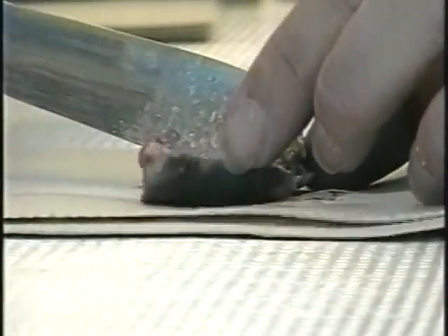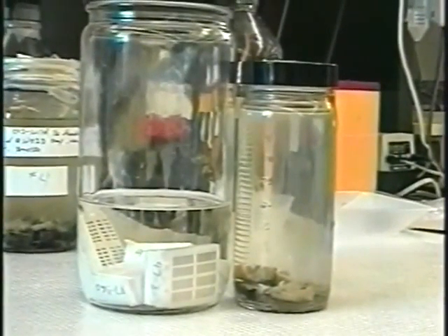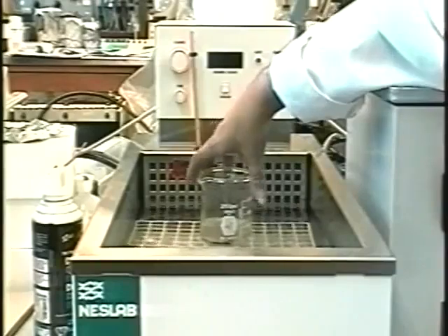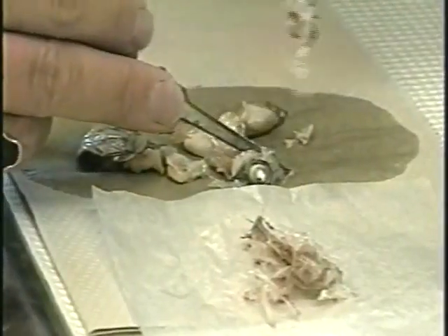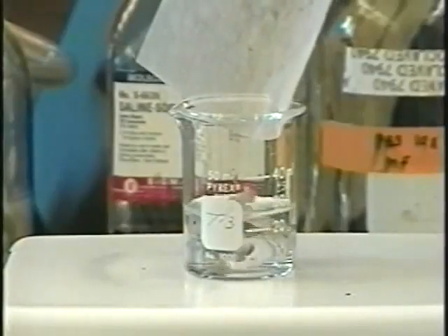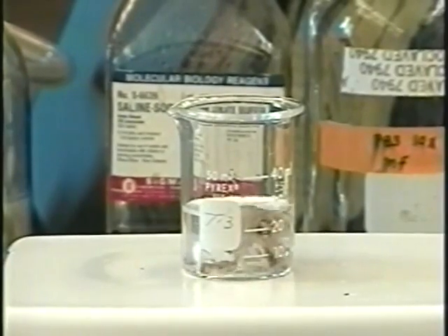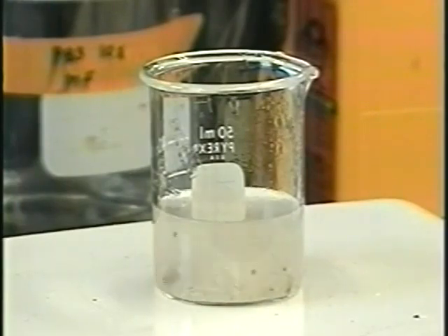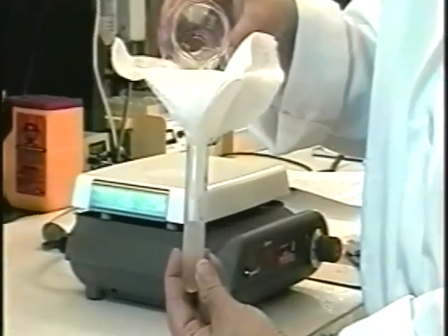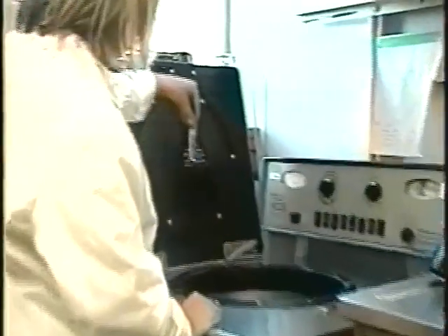First, heads from the fish to be tested are cut in half, retaining one half for histology. Next, deflesh the heads by heating in a water bath. All bone and cartilage is then placed in a solution containing the enzyme pepsin, which is incubated for several hours at 37 degrees centigrade. Then the undigested material is transferred to a trypsin solution for further digestion at room temperature. When the cartilage is mostly digested, pour the material through cheesecloth and centrifuge the filtrate to pellet the spores.